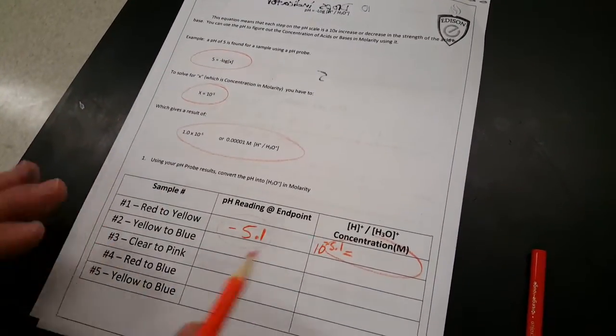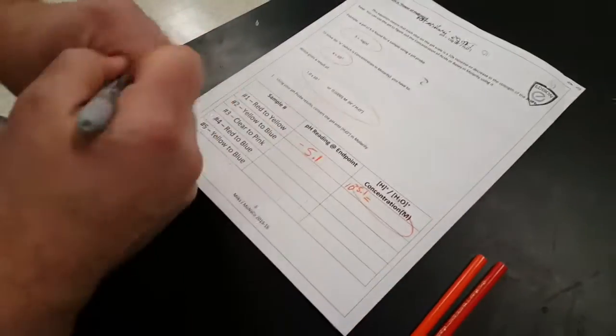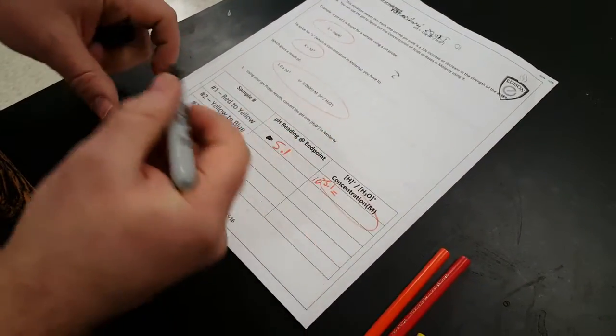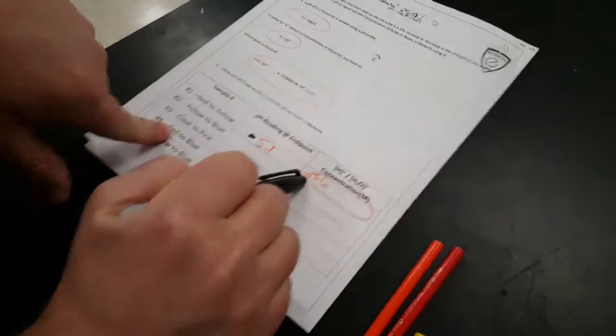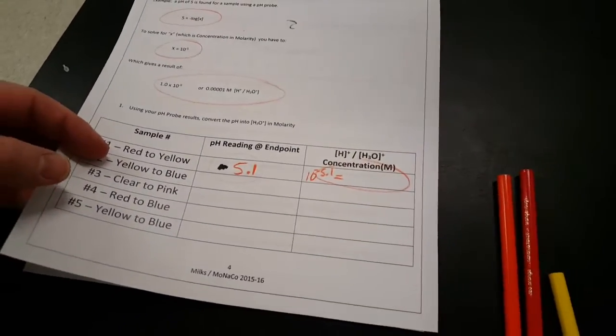So we have our pH, we're kind of working a backwards algebra. But this number's not negative. No, that number is not, in fact, negative. That was my pH reading. But I make it negative when I plug it into my logarithm, or my inverse log, to get my concentration in molarity. Okay. So no CEI in this lab. No, because this is about you seeing the color changes so you know how to use your indicator on the next lab and relating those color changes to the pH using a pH probe. So okey-dokey. Anything else to add, Mr. Milks? No, I think we pretty much covered it.